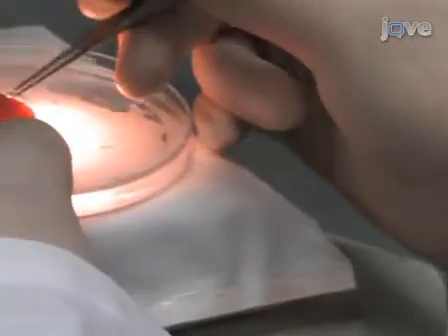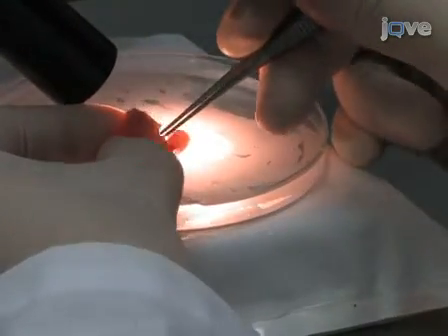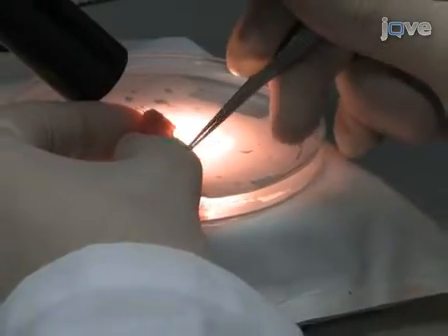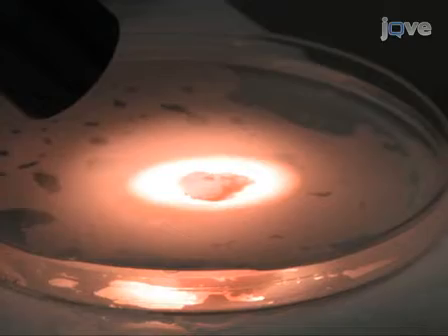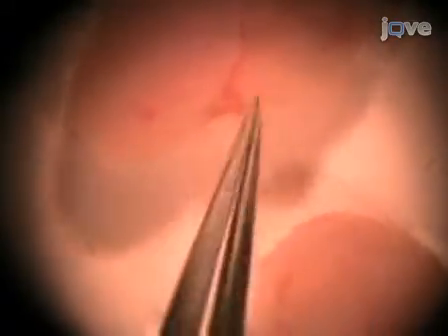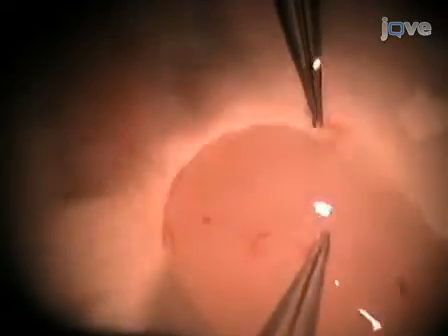Place the brain in a petri dish filled with cold dissection media. Dissect both hemispheres and remove the meninges. Next, dissect the hippocampi. Chop the hippocampi into approximately 1 by 1 millimeter pieces.